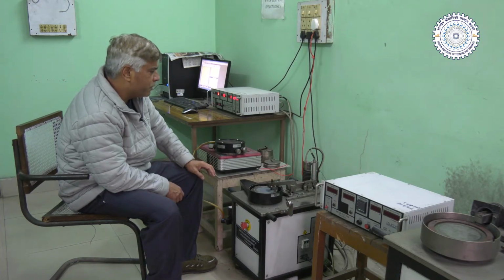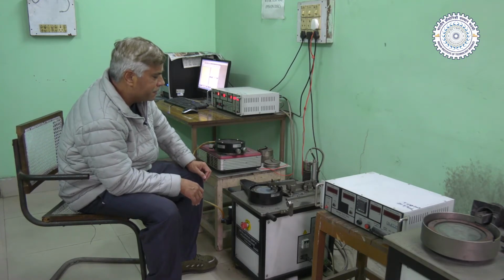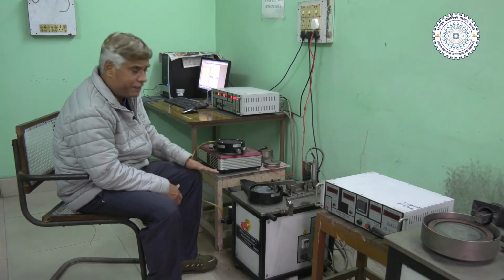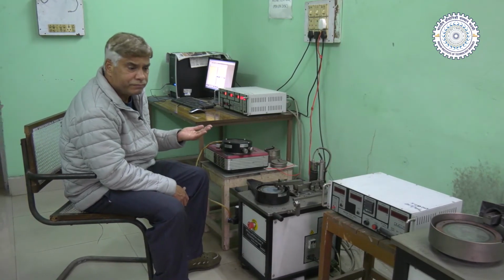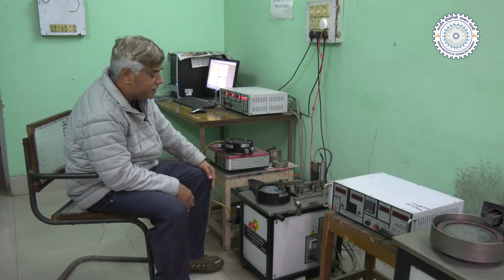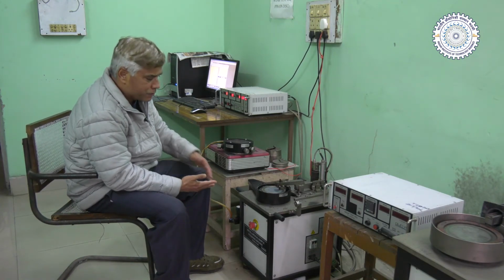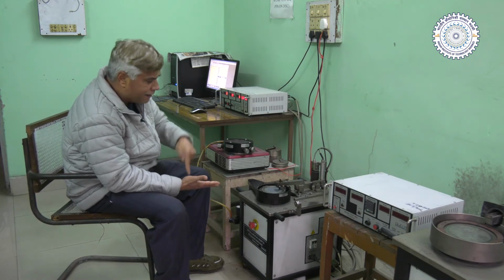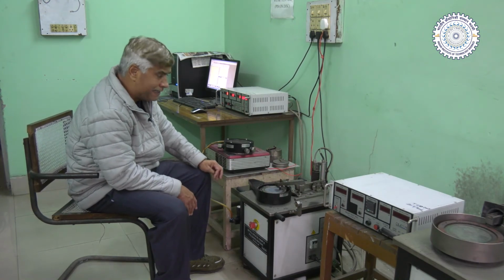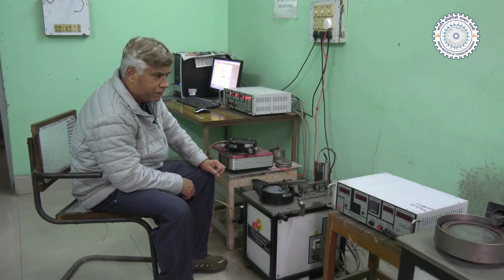Now, there is another very good use of this kind of setup. We can replace the steel disc with emery paper or another abrasive medium, if we are interested in performing an abrasive test. But this is not the standard way of performing the abrasive test. Most of the time, pin on disc is used for performing the adhesive wear test, where one metallic pin is rubbed against another hardened metallic surface, which is most of the time hardened steel only. So now we'll demonstrate the adhesive wear test, how it is performed.